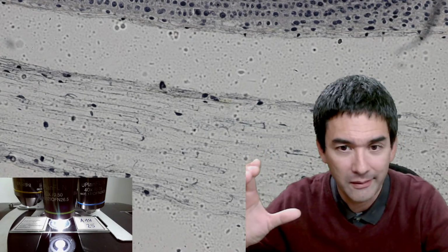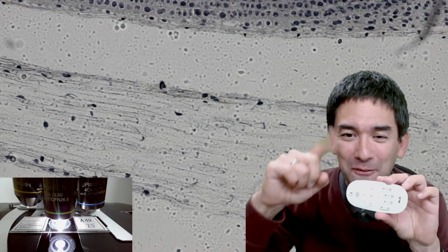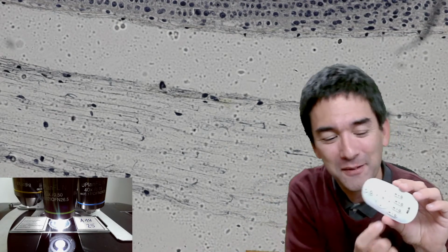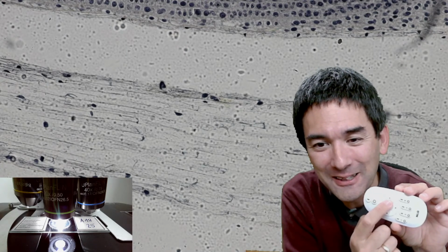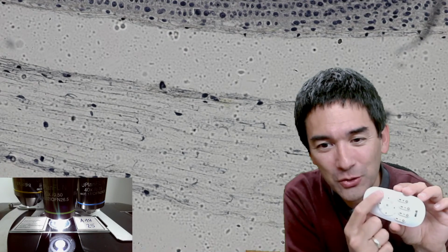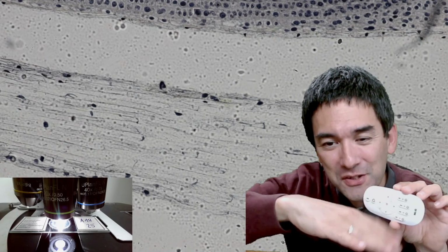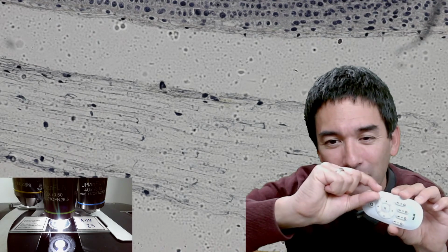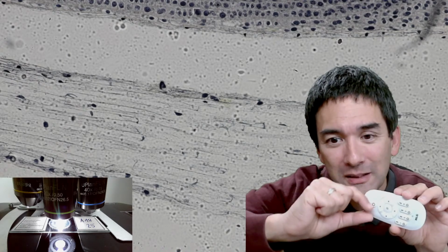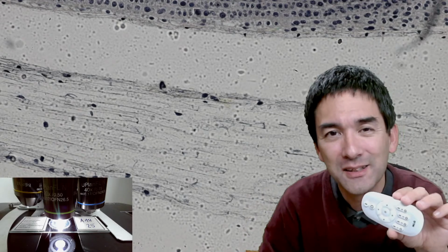So if you have, for example, a three-dimensional cell, I'm going to use my radio control for the lamp here as an example of a cell. Let's say that this is the nucleus, right? And I'm taking a cross section only from the top up to here, and I'm not seeing the bottom part. I'm just looking at a thin section, which is, let's say, above or below the nucleus. Then I'm not seeing the nucleus. So this does not mean that the cells don't have a nucleus.